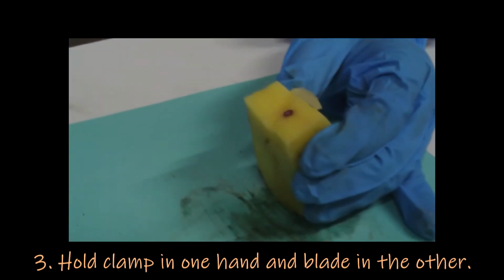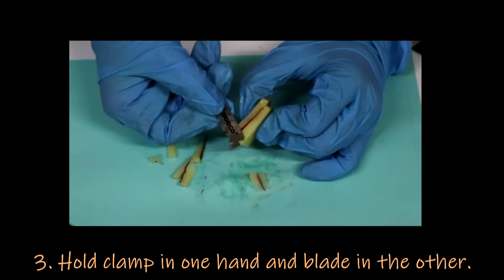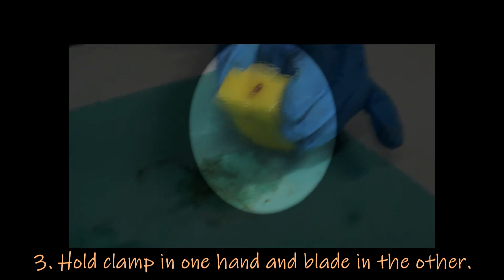Third, hold the support clamp containing the specimen in your less dominant hand, between your thumb and forefinger, and in the other, hold a sharp razor blade. As you can see, the end to be cut is positioned a little forward than your thumb and forefinger.